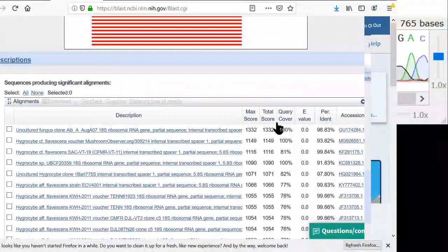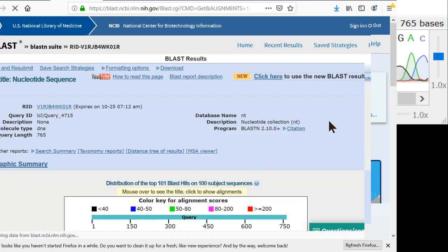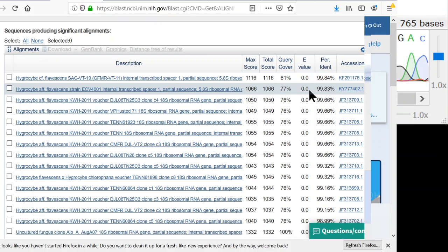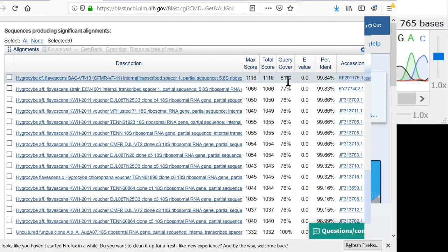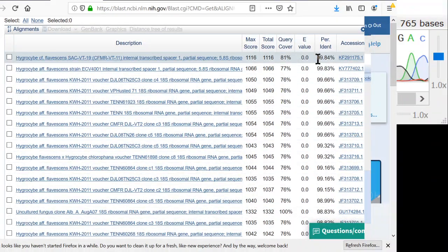So keeping in mind that the query coverage should be high for a solid answer, I like to sort by the ident field. And ident is counting what percentage of the bases in your sequence match the bases in the reference sequence. So sorting by ident, the top matches come to the top, and then you just have to keep in mind that the query coverage has to be high, because normally it sorts by max score, which takes into account both query coverage and ident. So here's the top match, which only has a query coverage of 81%, and our ident in that is 99.84, which means there's only one base difference between that and the other.